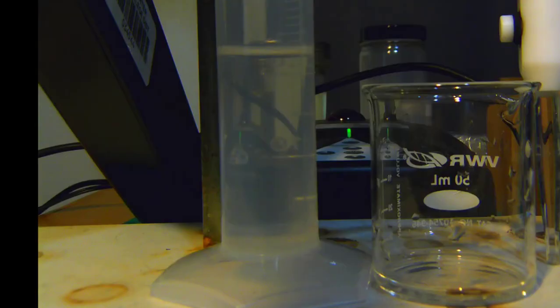Let's go ahead and take a look at the objects we'll be measuring with. So we have 3 things here. We have the graduated cylinder over here. We have the beaker right here. And then this is the tip of the burette, which is a very long device, and we'll be taking a closer look at that when we get to that measurement. So we'll be going through making measurements with each of these in turn, where we will focus in on where the liquid is located as we make that measurement.